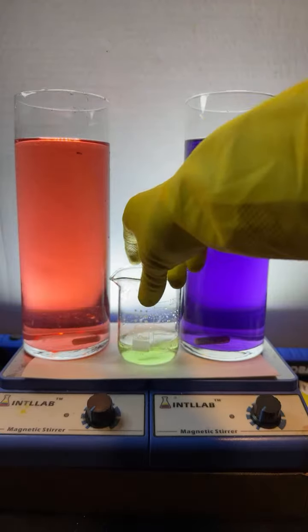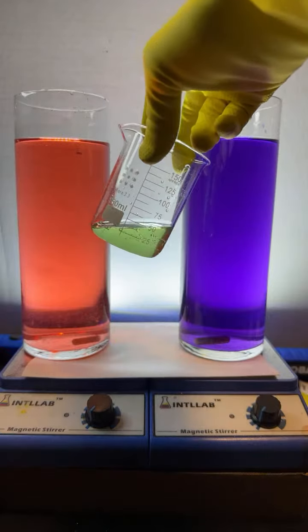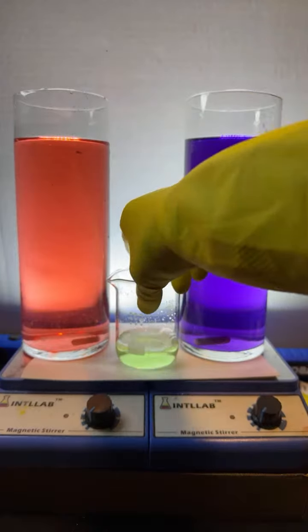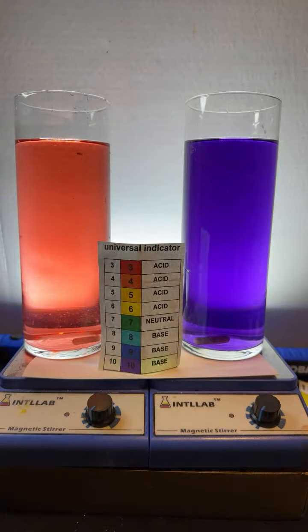Because over here, I have an acid. Over here, I have a base. It just happened to work out that they look fairly well balanced because when I add equal volumes of them, they neutralize each other. See, here's our pH scale. Man, that worked beautifully. See that? There's a pH scale.